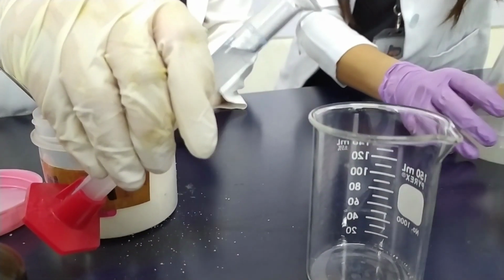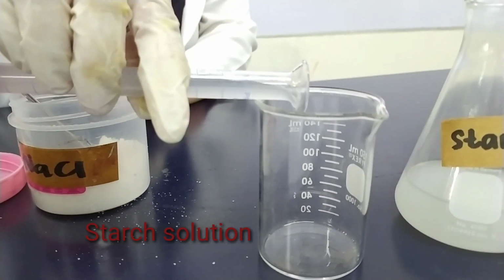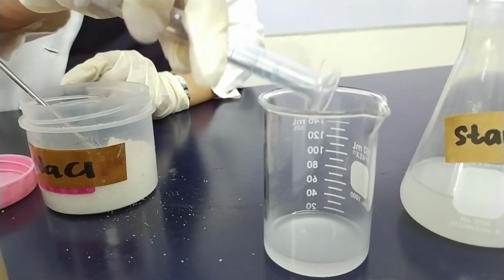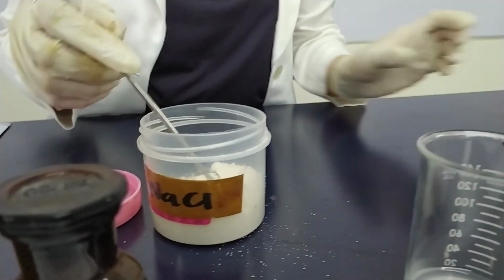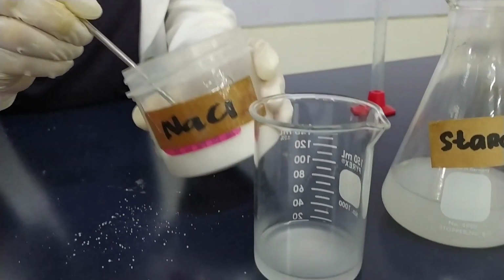So for procedure number 2, prepare a starch solution and then add 1 tablespoon of table salt, or what we call sodium chloride, and 1 ml of glucose solution. Stir and let it cool.